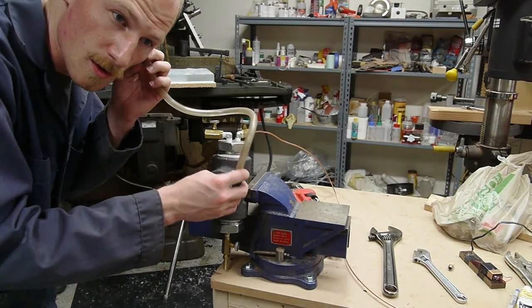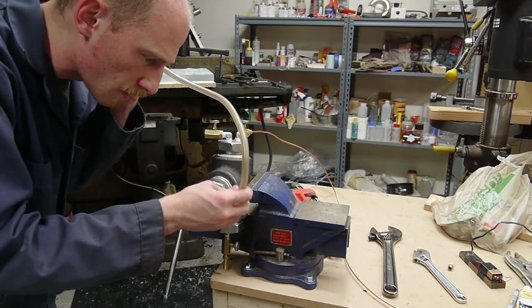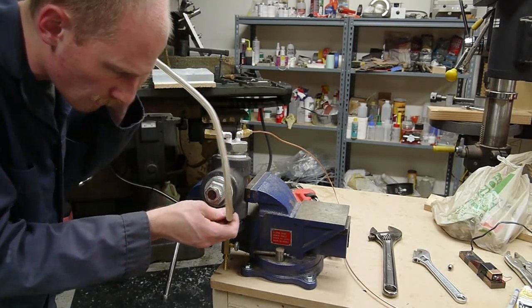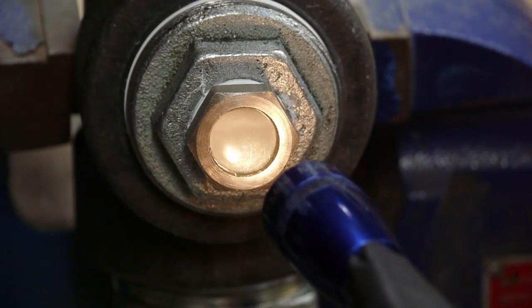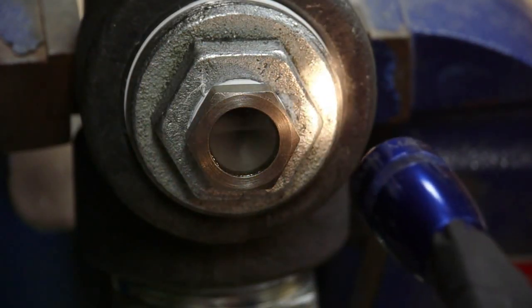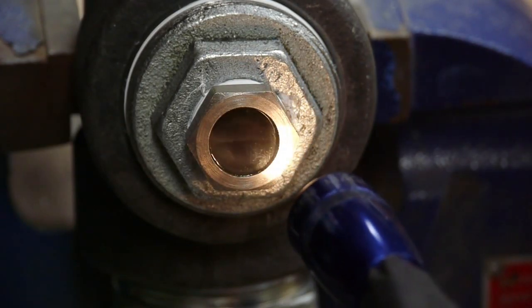I went around it with a tube—this is a really good way to check for leaks, just listen for them with a tube like this. It seems pretty much fine. I'm going to leave it full of liquid CO2 and come back in a few days or a week to see how it's doing.